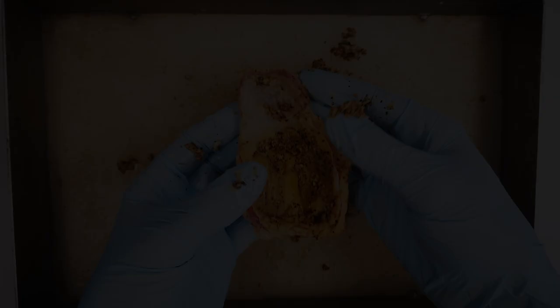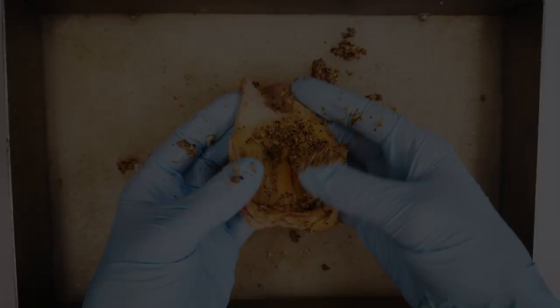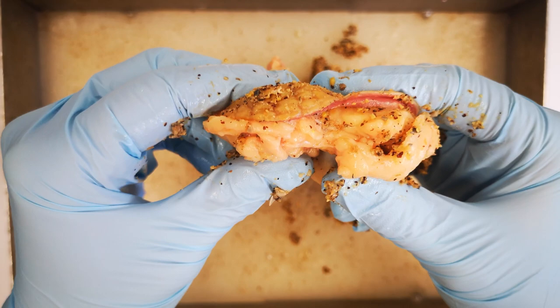The gizzard is equipped with hard parts such as friction plates or grinding teeth, and in some cases, stomach stones. The gizzard of birds is lined with the gastric mucosa. There is a submucosal membrane underneath, followed by the actual muscle layer.